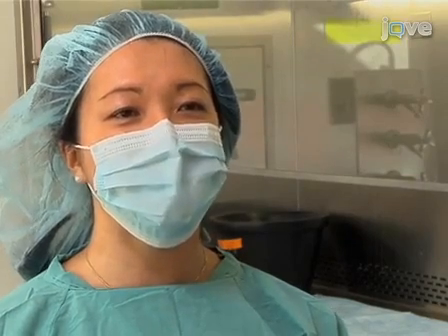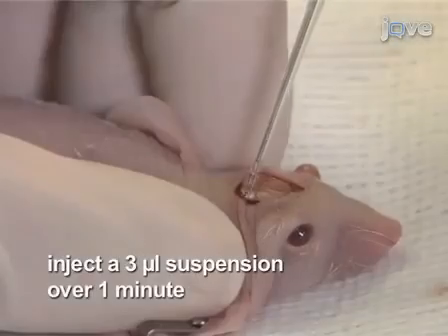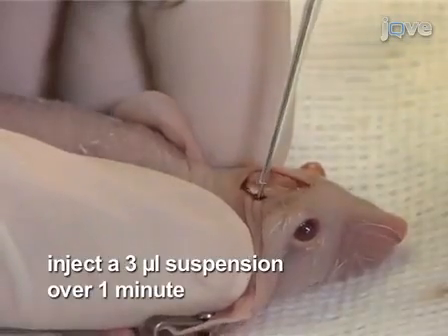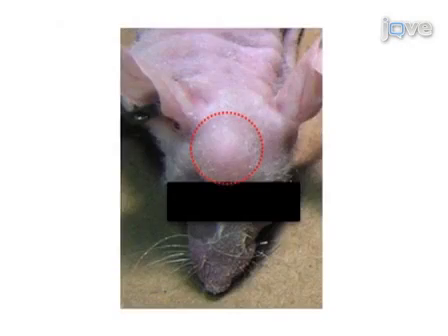In order to ensure the tumor is established and grows in the correct location of the brain, next, place the syringe perpendicular to the skull in the hole and slowly inject the cell suspension. Injecting larger volumes than recommended can result in tumor cell reflux through the needle tract, with resultant exophytic rather than intracranial tumor growth, as shown here.